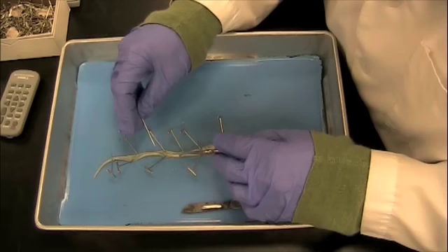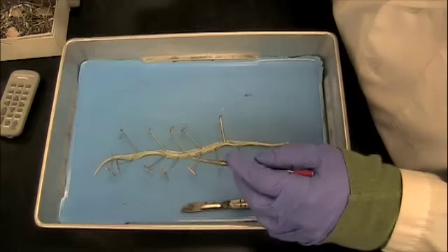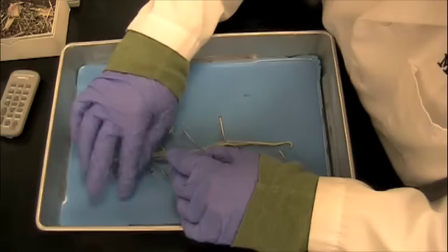Ascaris infections are very easy to prevent and very easy to treat. They rarely cause serious problems for the person who is infected. I've got my specimen open here. Zoom in so you can see.